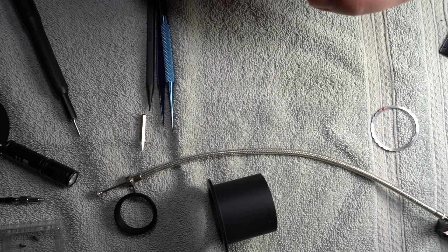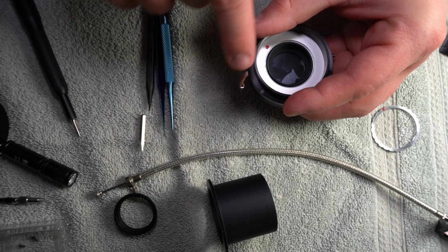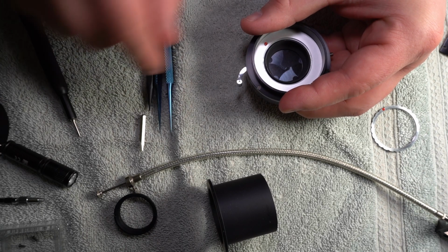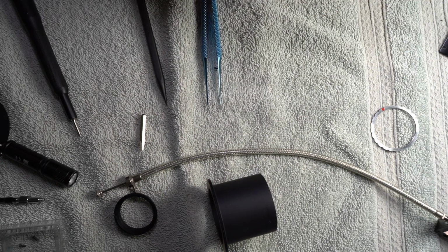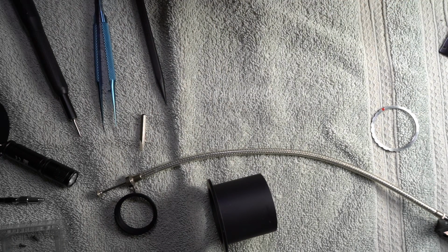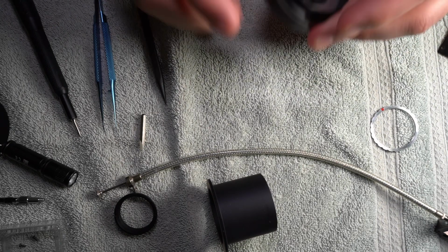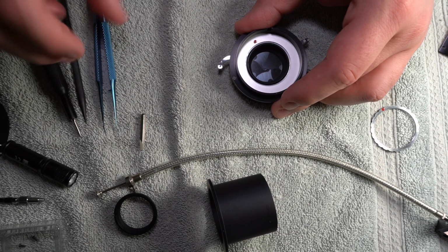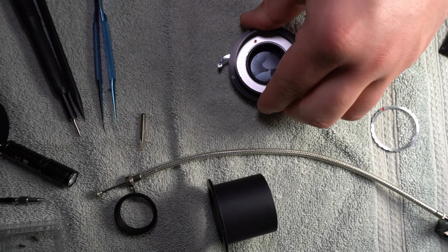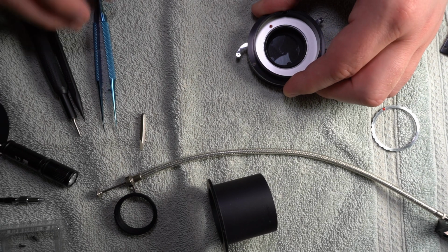Why does that move though? I don't know. Basically, the other part of that spring-loaded thing, there's another pin that was black that has to line up with this little hole here, which is what I thought to begin with, but it was switched around or something because I'd moved this ring. I don't understand what that does. I really don't understand what that does, but it's on now. And I don't want to mess with any other parts.